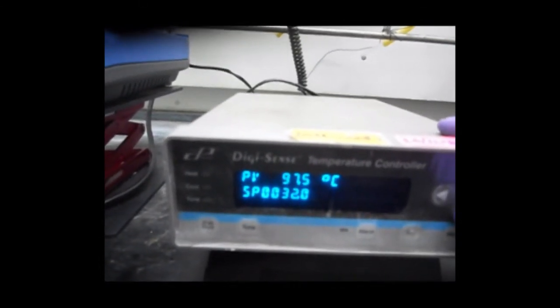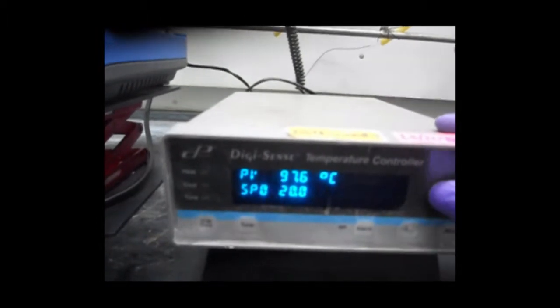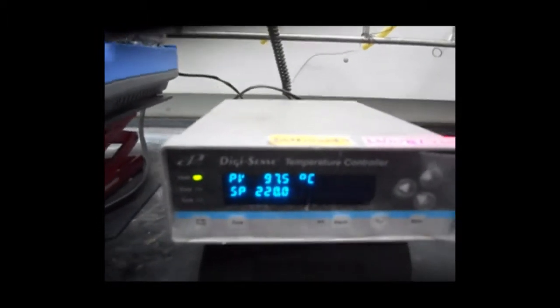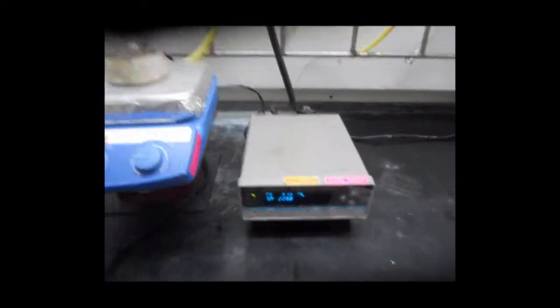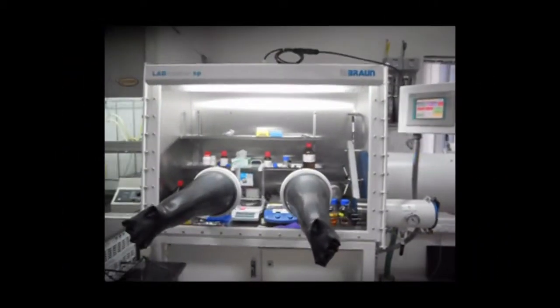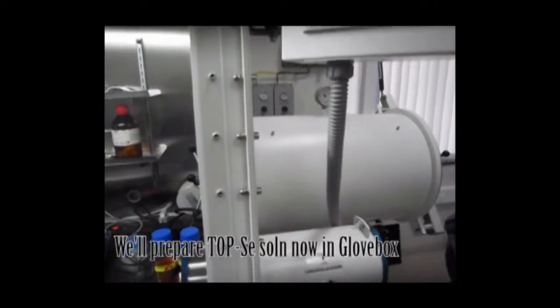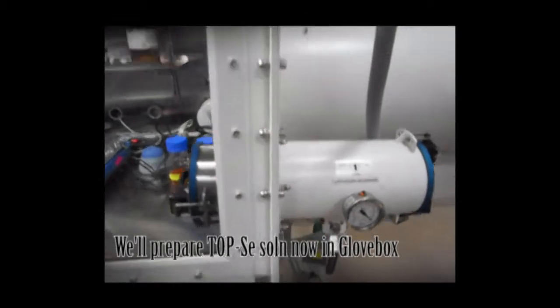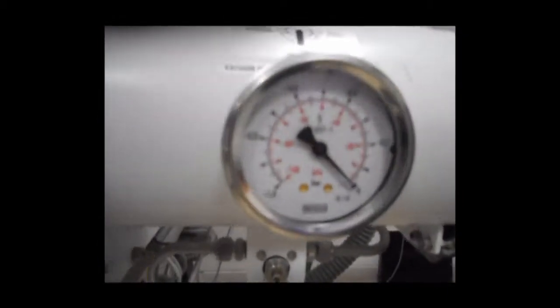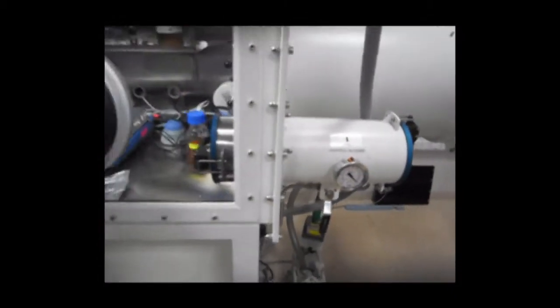At high temperature, all the oleate will bind cadmium and everything becomes soluble. That will take about half an hour. Meanwhile, we will prepare the selenium solution in this flask.